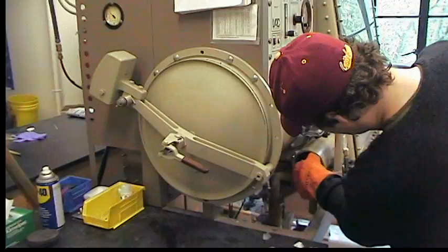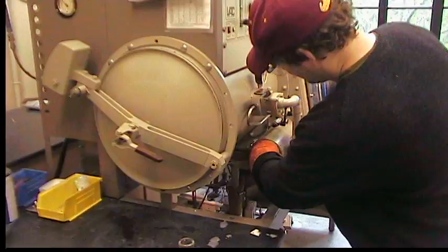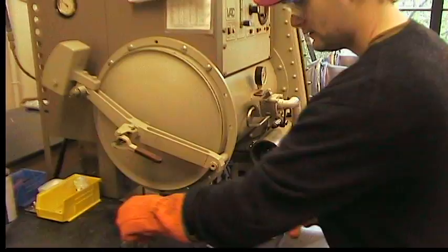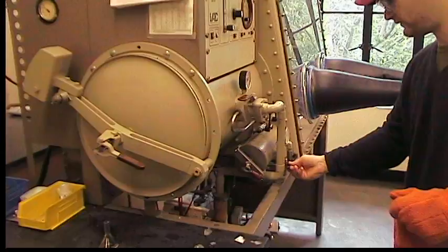You've got two antechambers there, John. I think we've got a big one, and we have as much stuff as we can fit in it. I want to do two pieces like that. And we'll give this about 10 nitrogen flush cycles for a minute.